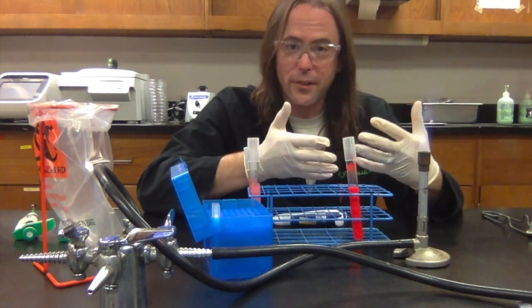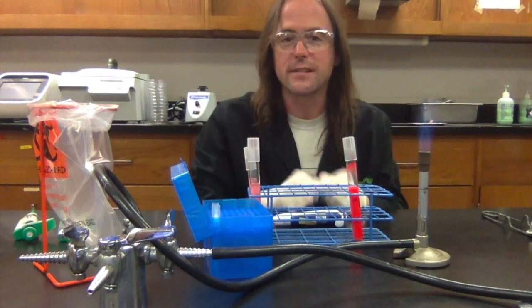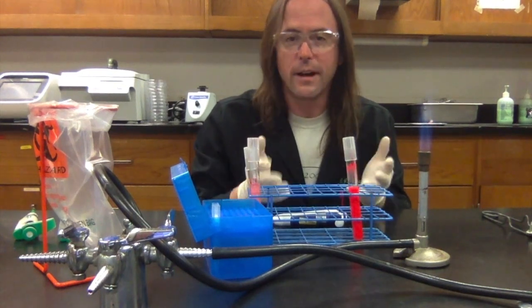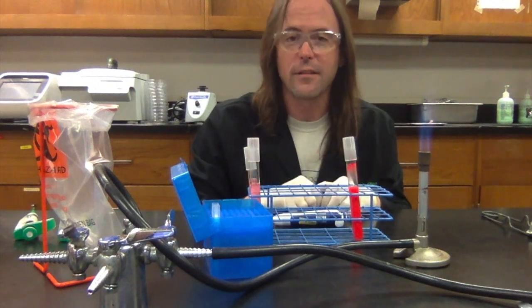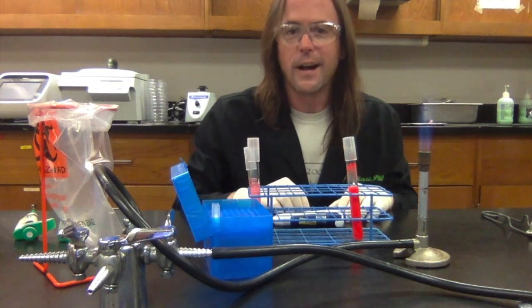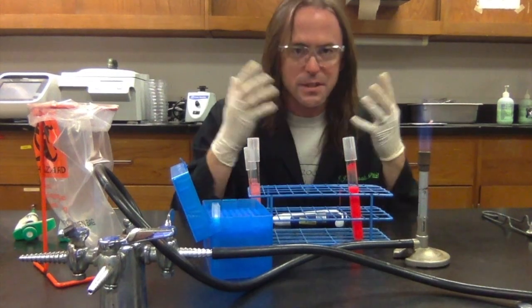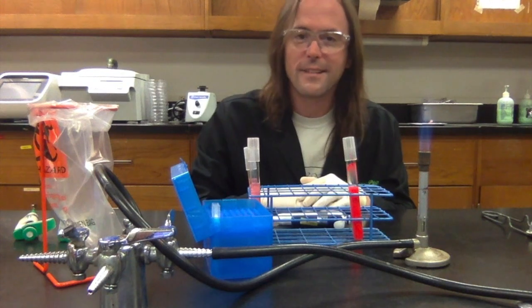It's possible to aerosolize your sample, which means to make small droplets that get outside of your tube or whatever you're working in and get into the air. And that's an easy way to get cross-contamination between samples, or worse yet, to contaminate yourself with the organisms that you're working with. Right? So don't do that. But just in case you mess up and do it, that's why we always want to make sure that we've got our eye protection on in the lab. So just in case you get splattered, you're not going to get bacteria in your eyes, right?